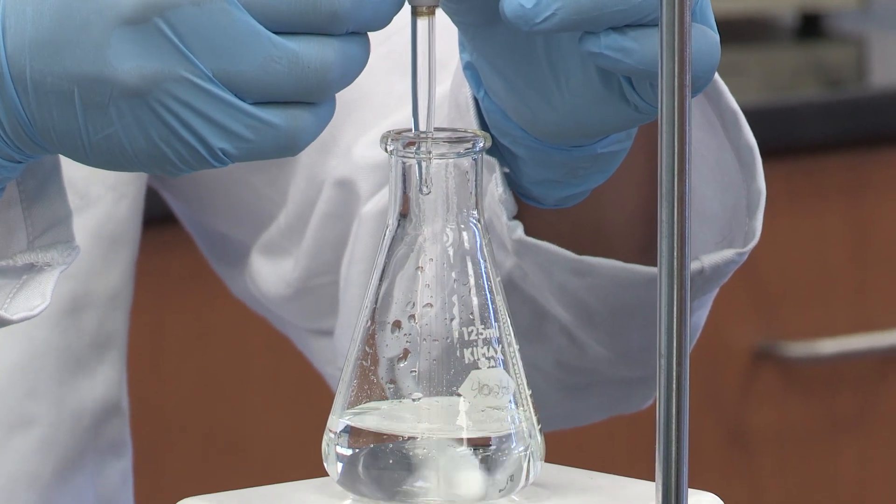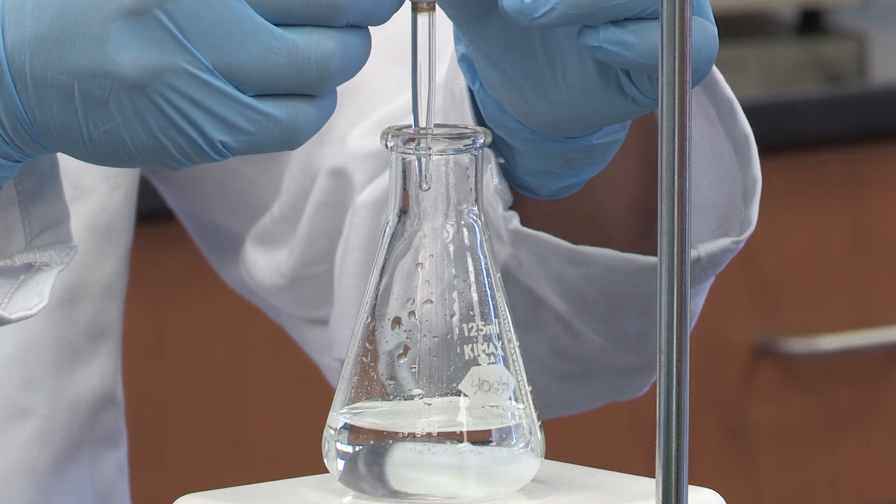Right now you can see the color stays much longer. Now we need to add drop by drop.